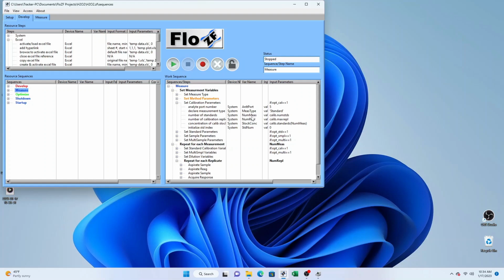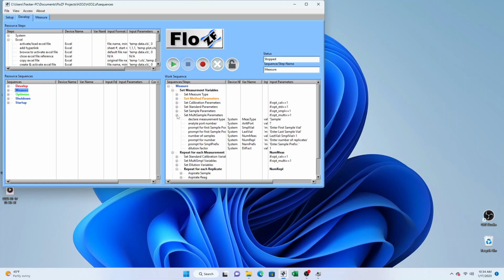Number of measurements is the number of times we're going to repeat this part of the sequence here, and that is equal to the number of standards that we have defined in the calibration table. Number of replicates is the number of replicates that the calibration table is going to ask for, and then the stock concentration is the concentration of the highest standard listed in the calibration table. All the other standards are created from that stock solution by doing a dilution as part of the sequence, and we initialize a counter called standard num. And so in a similar fashion, there are conditions for just doing a single standard, for doing a single sample, and for carrying out a sequence of samples from the multi-sampler.